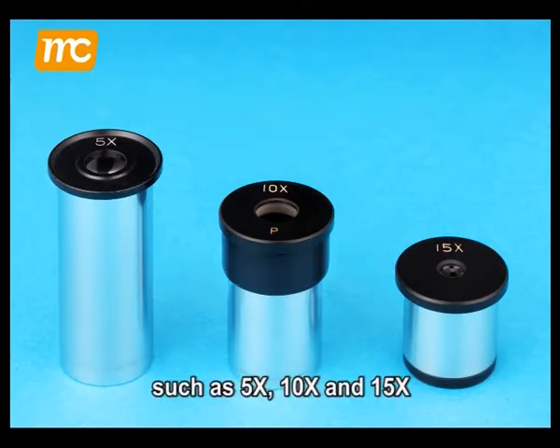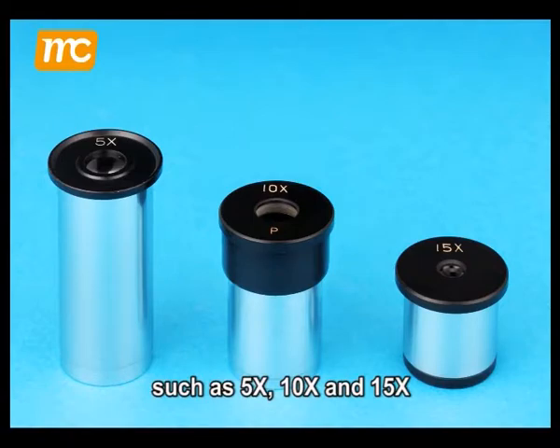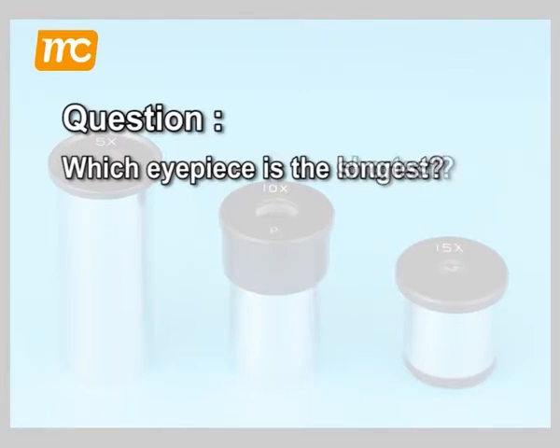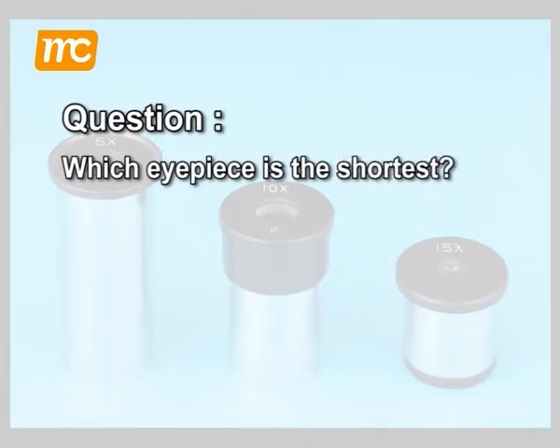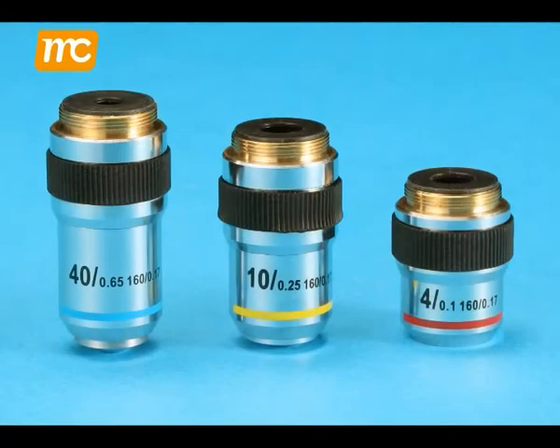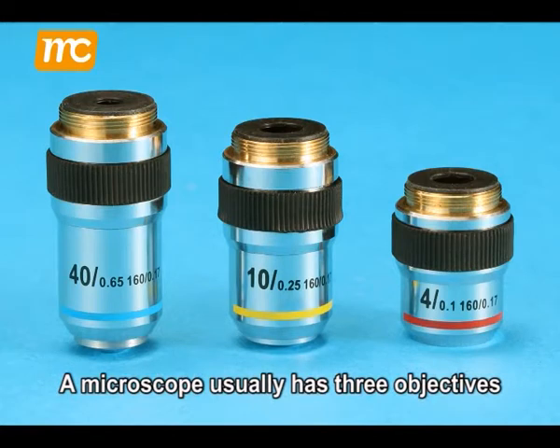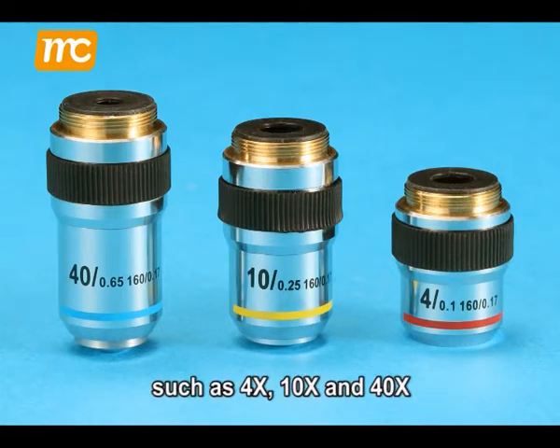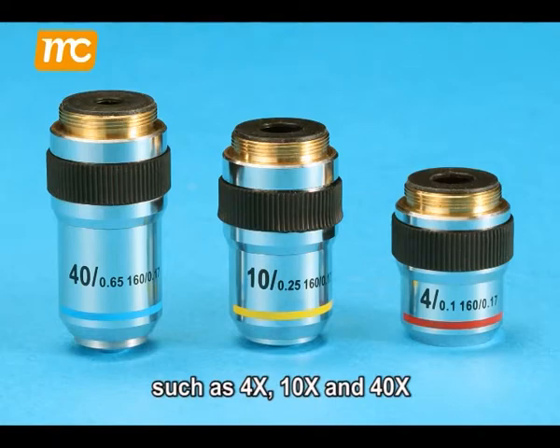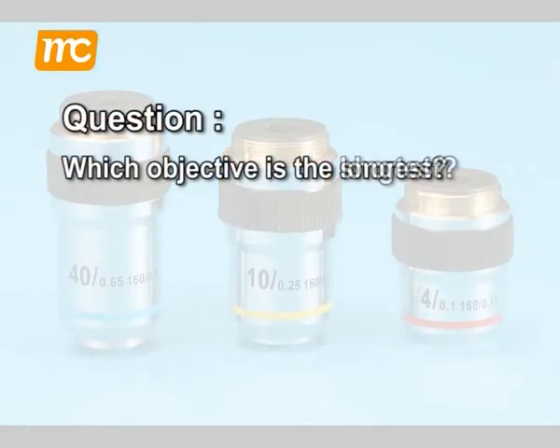A microscope usually has three eyepieces with different magnifications, such as 5 times, 10 times, and 15 times. Which eyepiece is the longest? Which eyepiece is the shortest? A microscope usually has three objectives, such as 4 times, 10 times, and 40 times. Which objective is the longest? Which objective is the shortest?